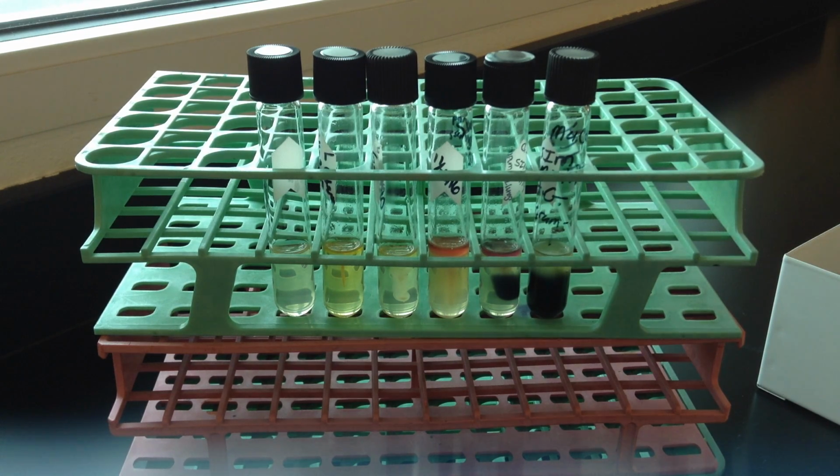So that's all I have for the SIM, the sulfur, indole, and motility test.